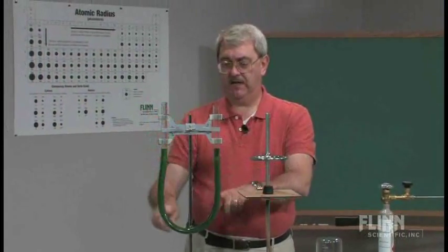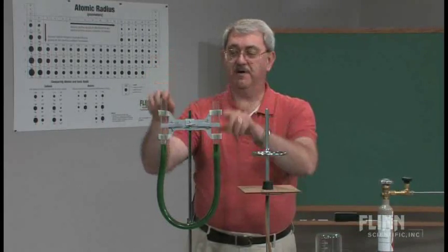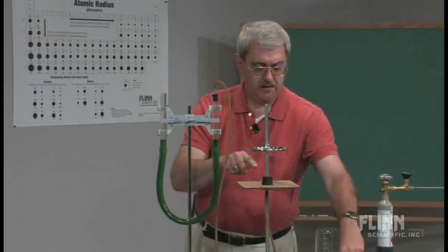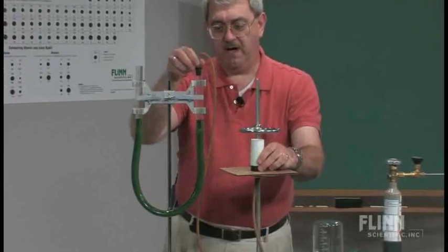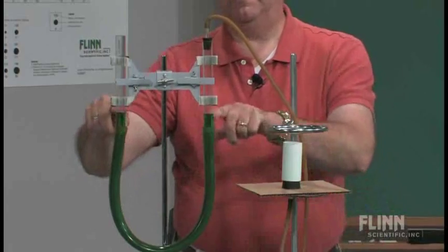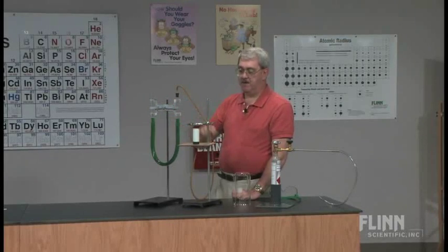We have a liquid — I've just made it green, green water, so that we can see it more easily. The levels are the same, indicating that the pressure on the two arms is atmospheric pressure on both arms, so the level of the liquid is equal. The tube is connected to the inside of the porous cup so that the pressure inside the porous cup is being measured by this manometer. The levels are the same; the pressure inside the cup is the same as the air pressure. Inside the cup pressure is being measured by this open-arm manometer.